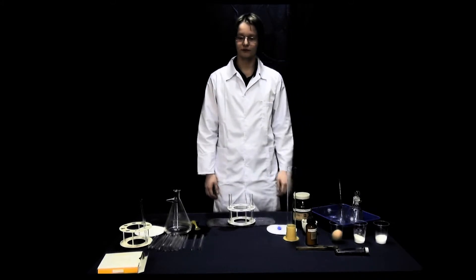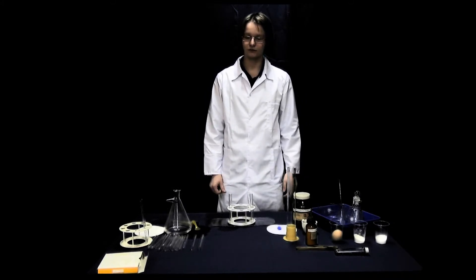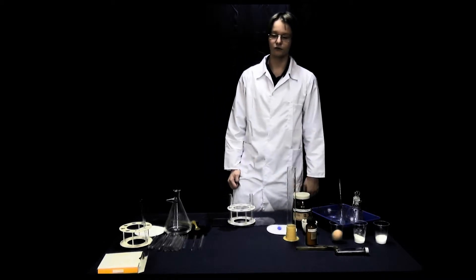Experiment 2. Research on the influence of mixing on speed of dissolving copper sulphate.